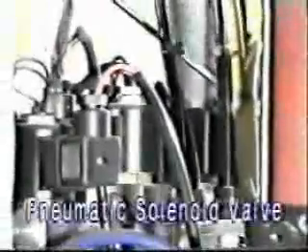These are the pneumatic cylinders which actuate to perform different operations like closing the capsule cap and body rings after filling, and tilting the closing plate with the help of a rack and pinion assembly. There are four pneumatic solenoid valves for actuating the different cylinders in reverse and forward direction.